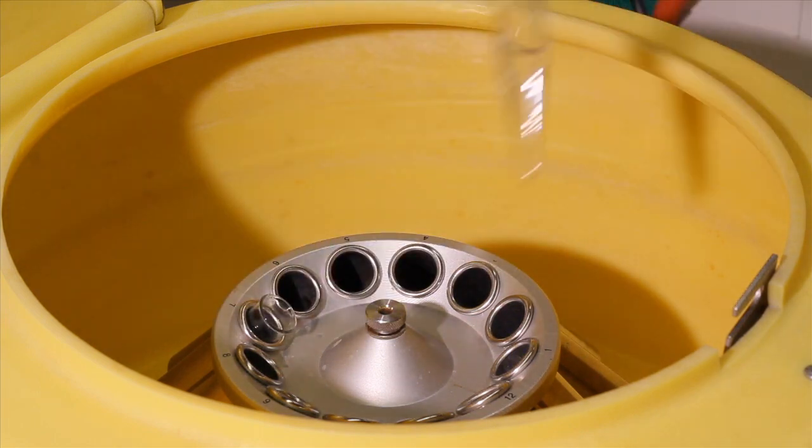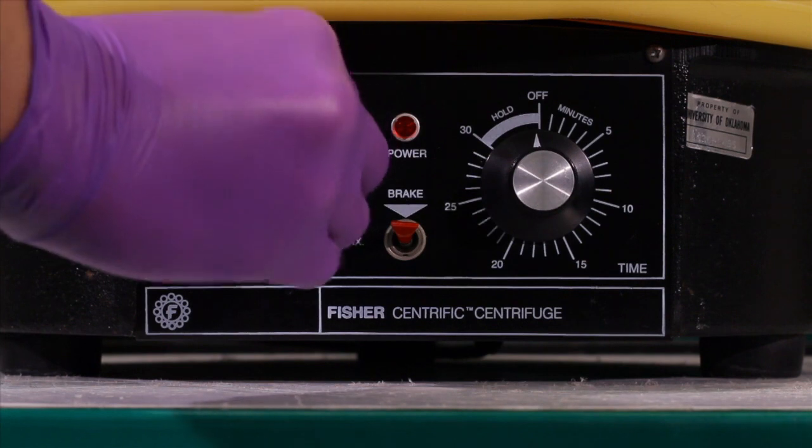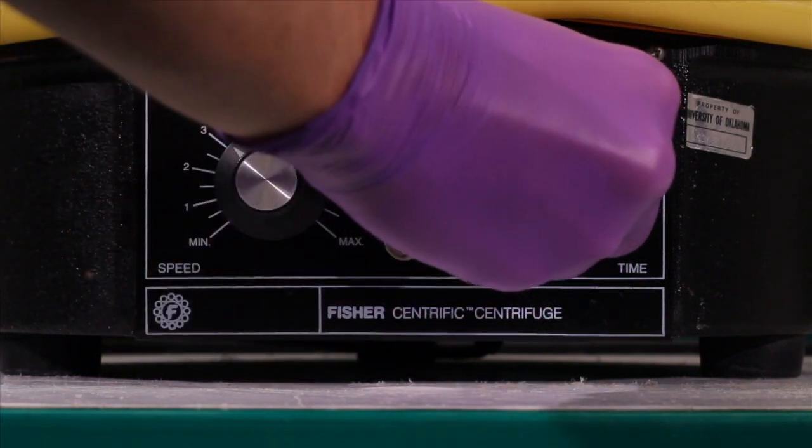Symmetrically distribute your samples in the rotor, then close the lid and lock it. To start the centrifuge, select the appropriate time and speed.